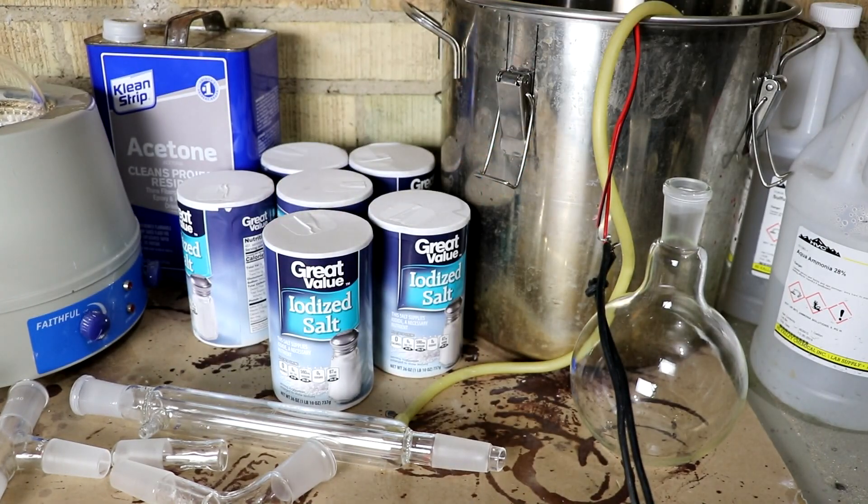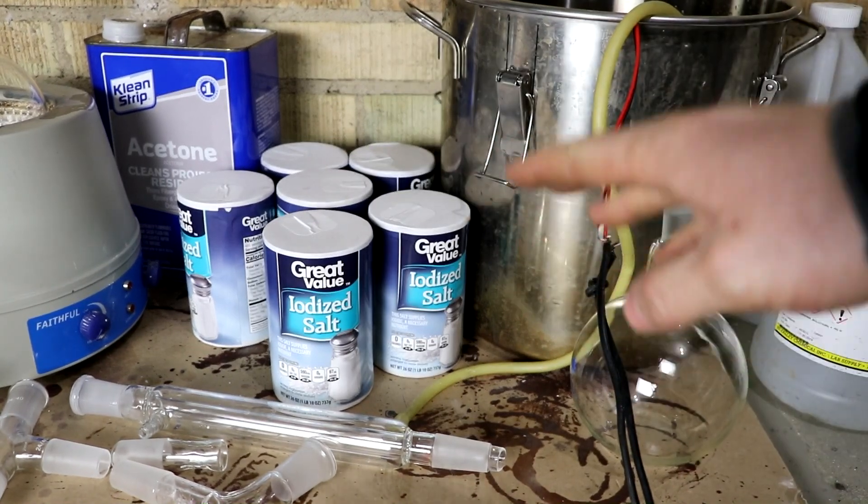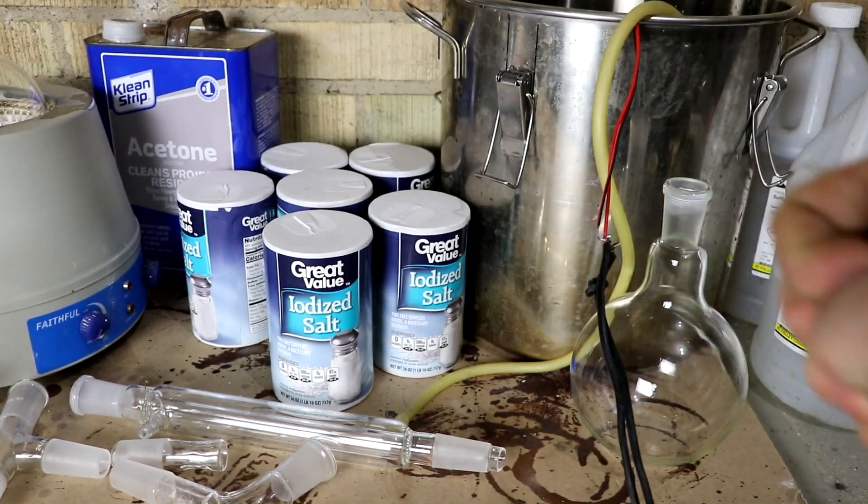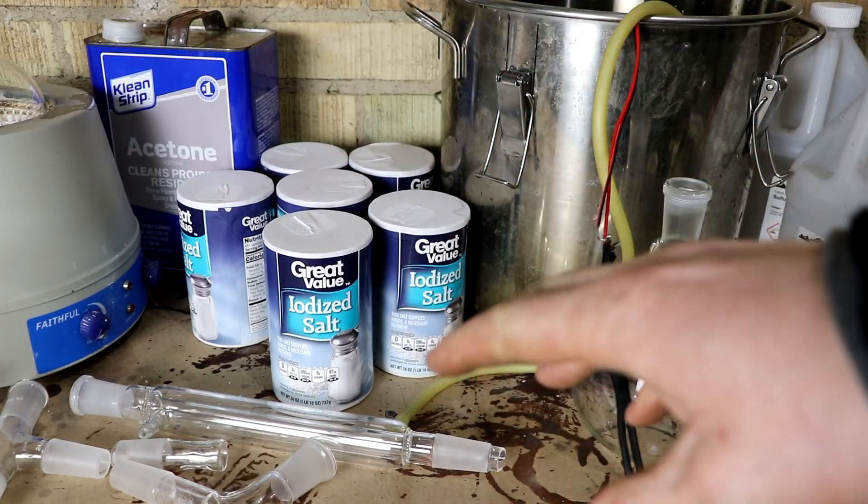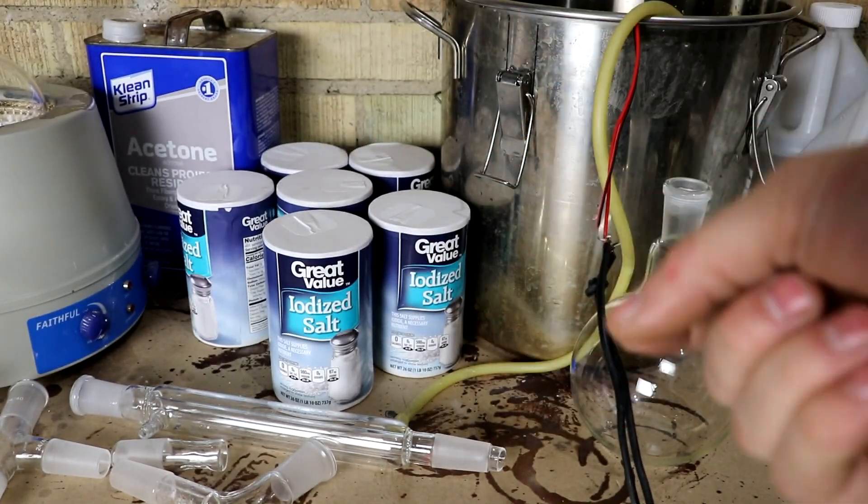But it should be rather doable. One thing I'm going to note before I start, this is not going to be a very practical way of getting iodine. It would be far cheaper and easier just to buy iodine or even sodium iodide.